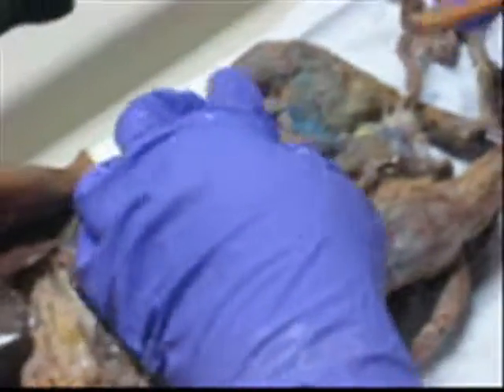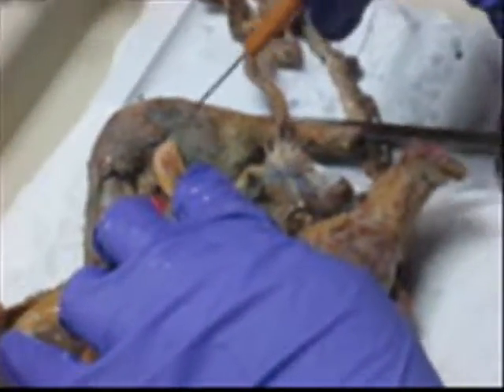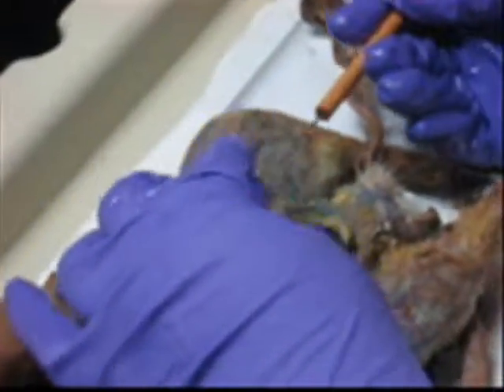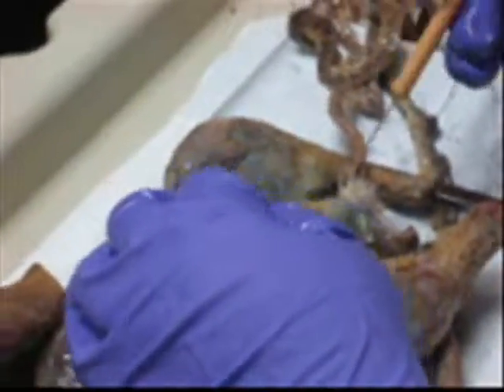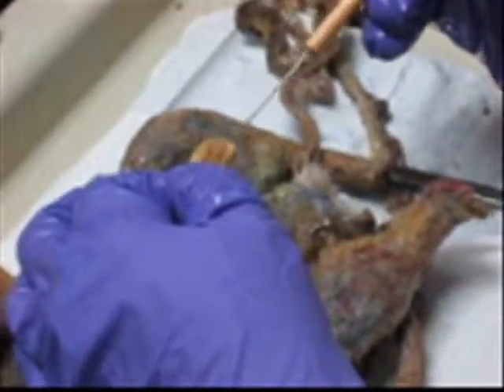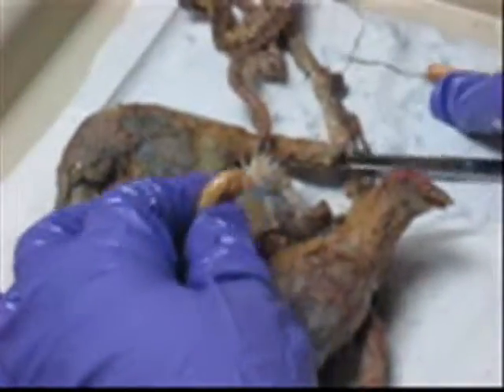Epididymis. Don't you see that it's different? It's like a flap over at the end of it. Do you see it? Epididymis. That's a testicle. Epididymis. And then here, vas deferens. If I take the whole thing and cover it out, it would be the spermatic cord. But if I only take this, vas deferens, and this epididymis, and this testicle.